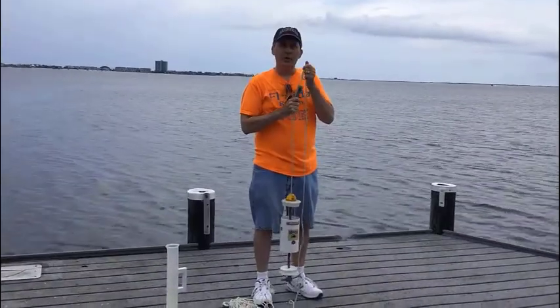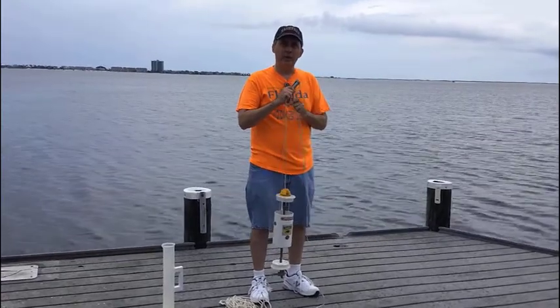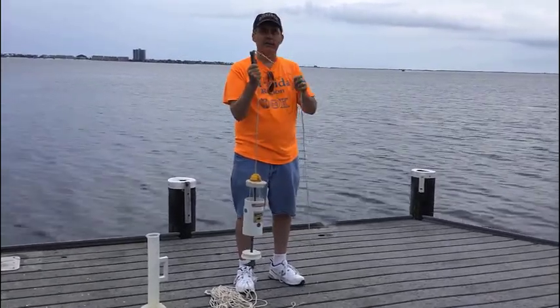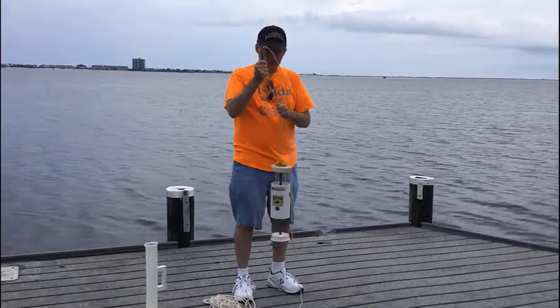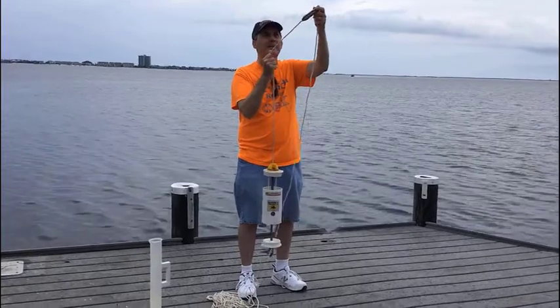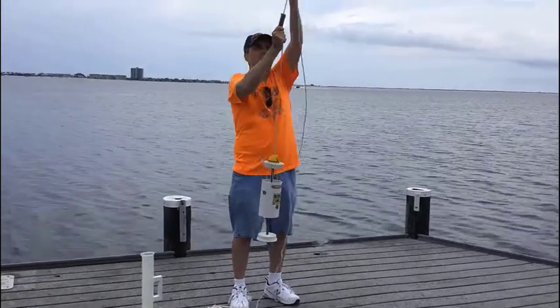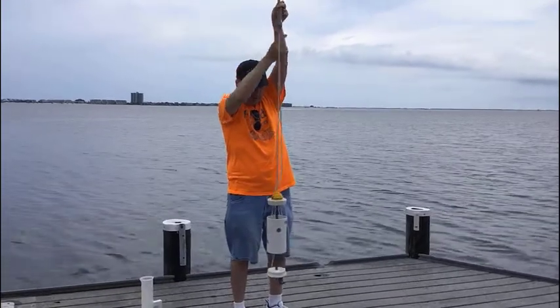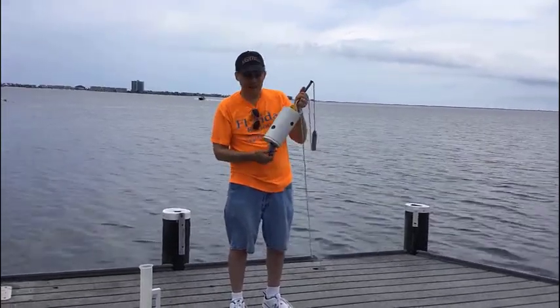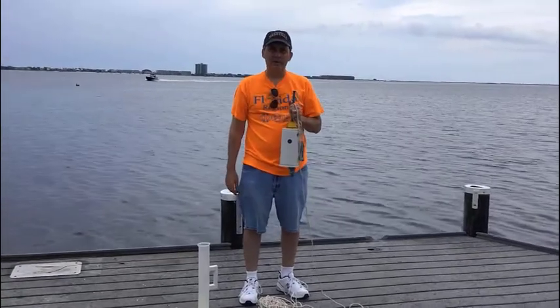Now we're going to use what's called a Kemmerer water sampler. This is designed to collect water from a certain depth. Our standard for the whole semester is to collect water from one-meter depth. There's a mark on the rope at the one-meter point — a little black mark. You lower this down until that black mark touches the water surface, then drop the metal messenger attached to the rope. The messenger triggers the device to collect the water sample. Pull it up, open the little nozzle by twisting, and put the water in the graduated cylinder.